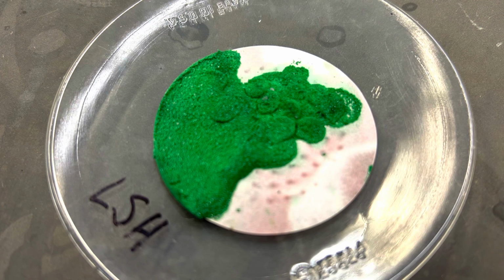After baking, allow it to cool for about 15 minutes and measure the mass of dry crystals obtained and place it in a vial to give your TA for next week's lab.